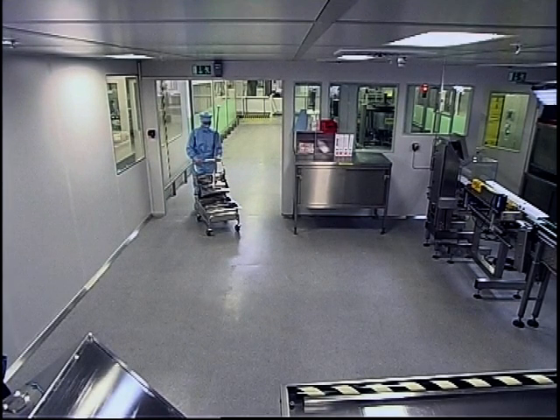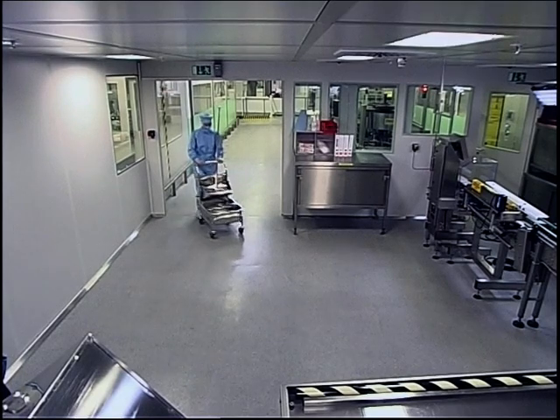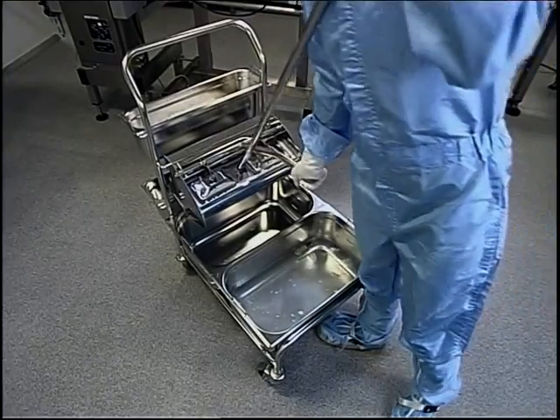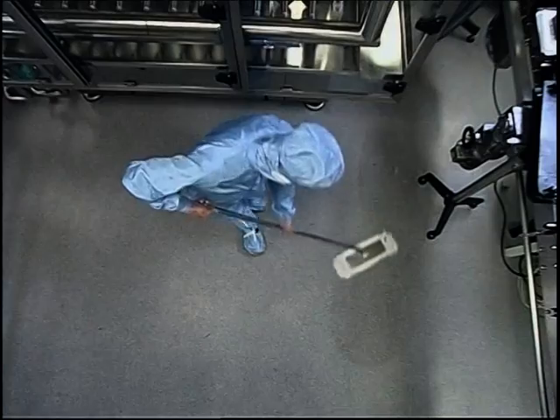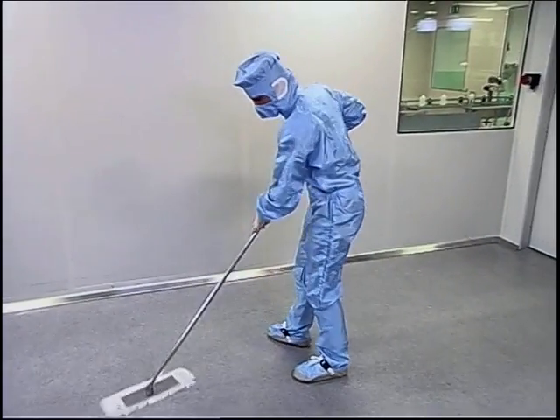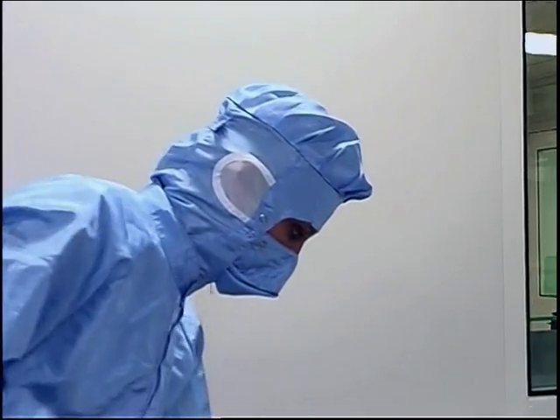When you watch this film, you may notice that the apparatus, machines and rooms where you work look completely different. But whatever you do and however you do it, the work is essentially the same everywhere. So I'll start. Production processes in all companies place very special demands on the clean room. In this area, the aim is to guarantee the cleanest possible production processes with the least possible contamination.